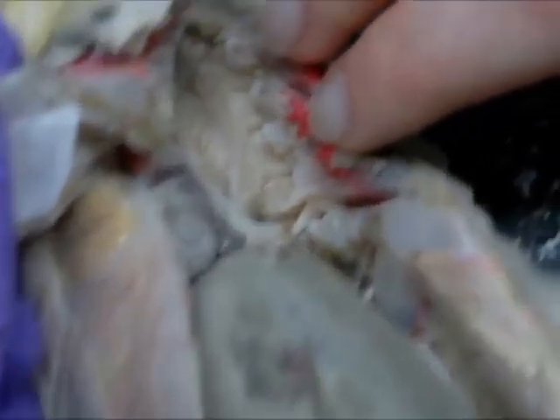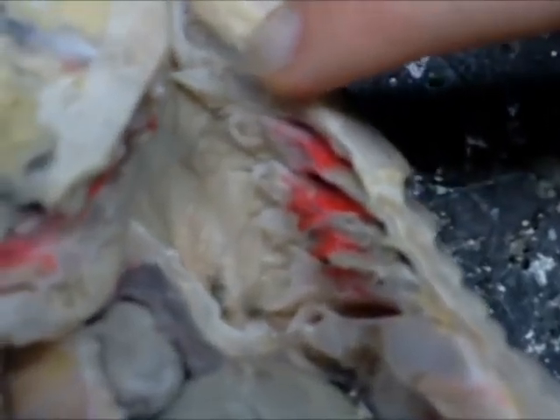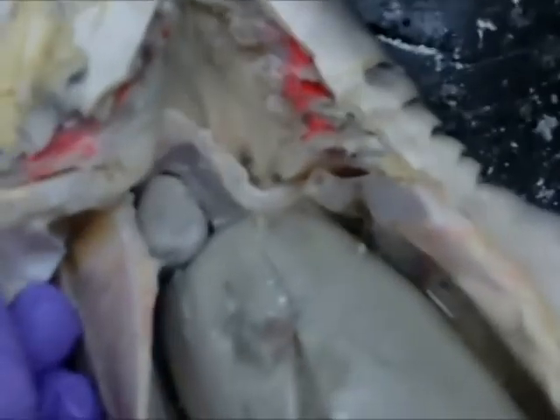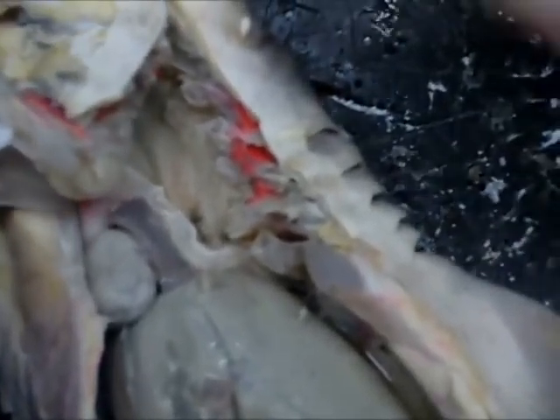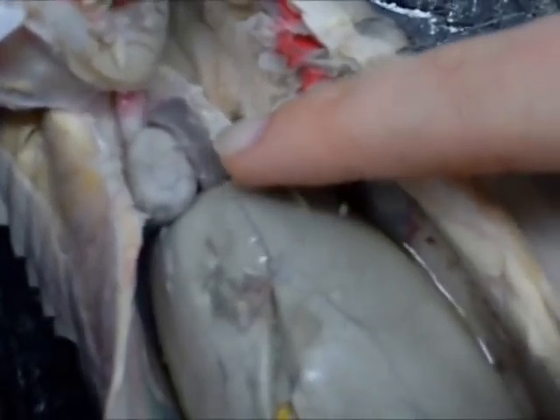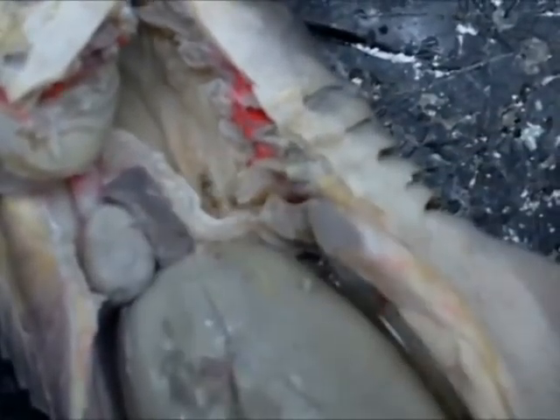The gills. And here we have the heart, and possibly the aorta.